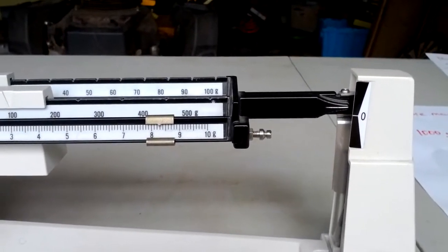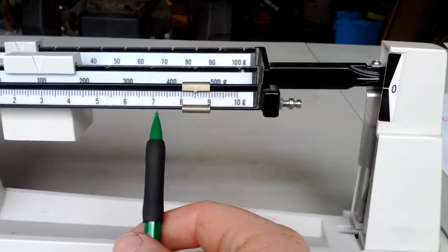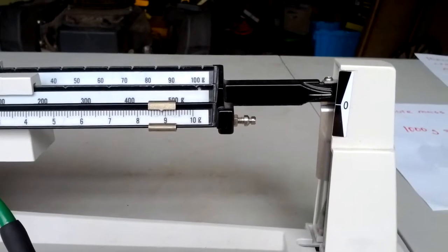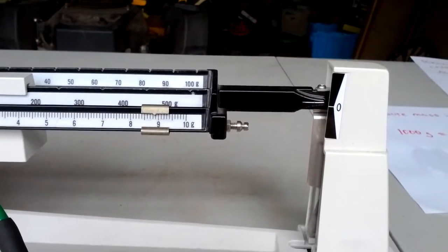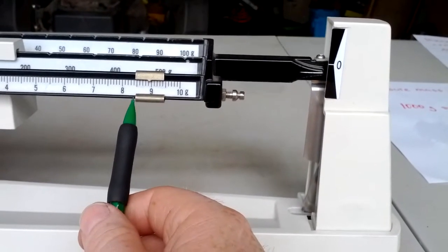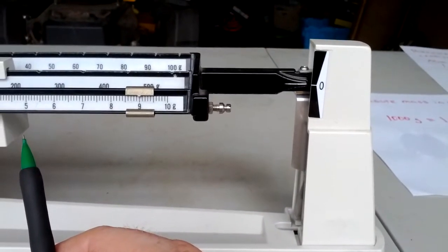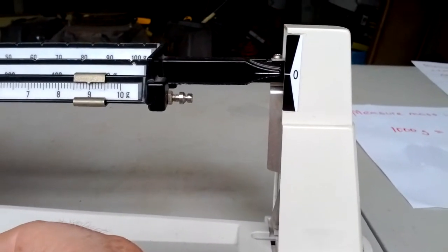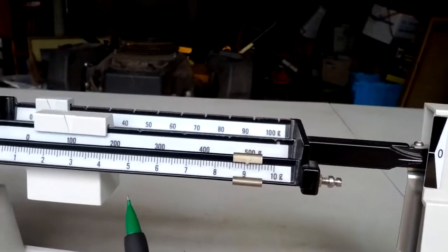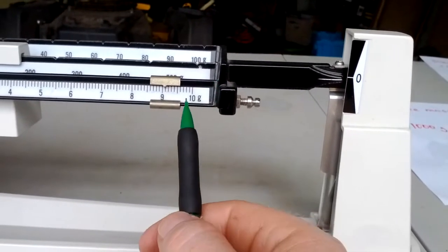So I'm going to keep sliding. Well, it's starting to dip down now. So we're getting close. So now you just kind of do like one little tenth of a gram at a time until you get right to zero. We're really close now. But look, when you let it bounce around, it still rides up a little bit above the zero. So that means I need to go over a little bit more. So we're going to go right at 9. That's getting really close. It's still just a tad bit above the zero. So I'm going to go just a little bit more. Let's put it right at 9.1 and see what we get. No, that's a little bit too much.